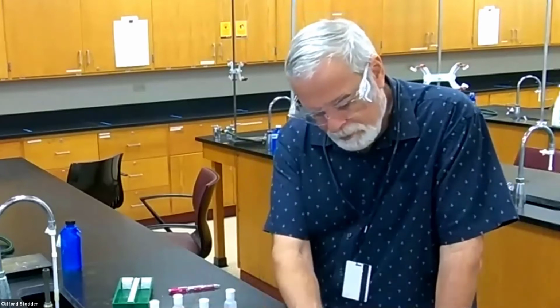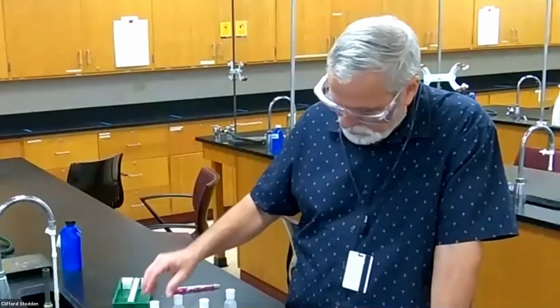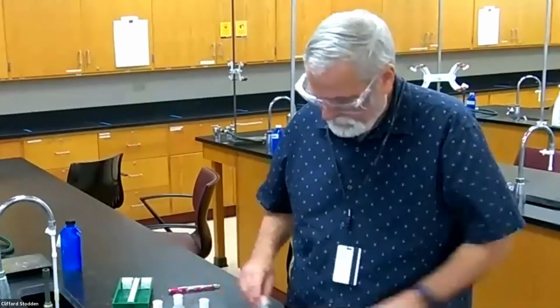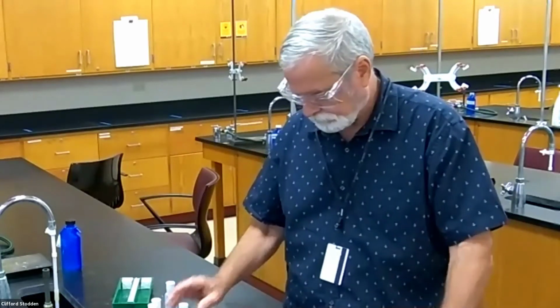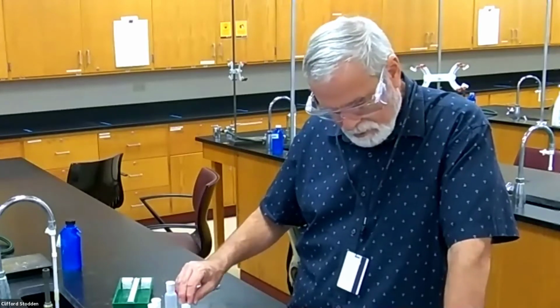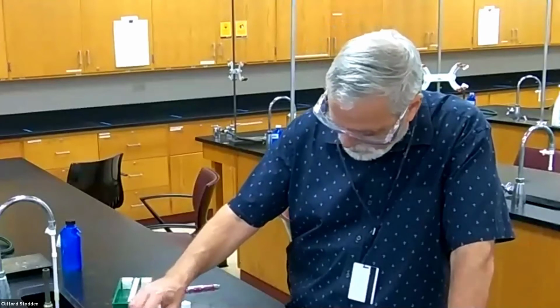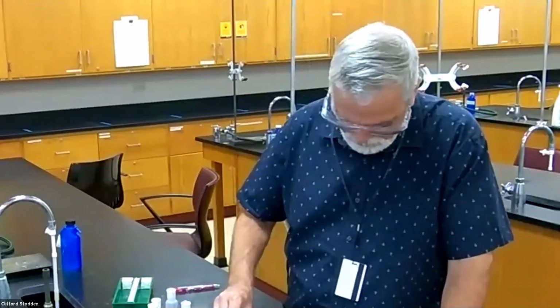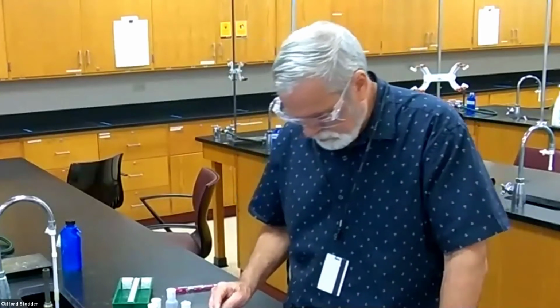Next one for barium chloride is nickel nitrate. Again, nickel isn't one of those that it's insoluble with, but I'll go ahead and try it anyway, because it is a different anion. For this one I'm adding nickel to barium chloride, so I wouldn't expect there to be anything, but I'll do it anyway. Okay, so there's nothing there.